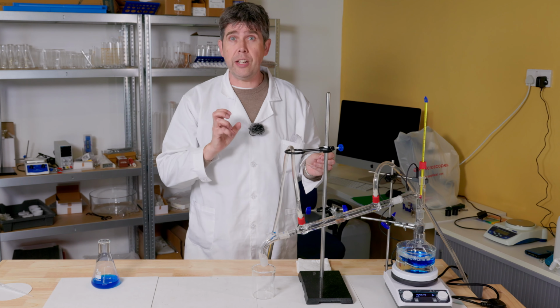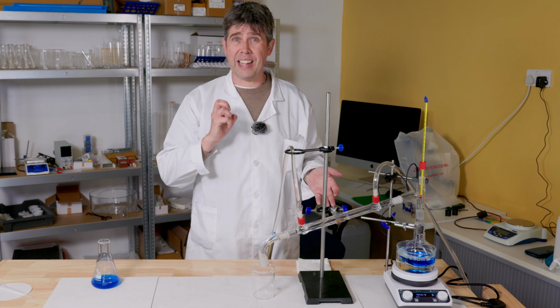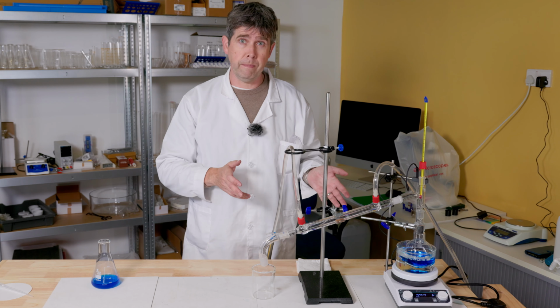This is so that I can gently fill the tube until it just overflows with water, as this will allow me to maintain a steady supply of cold water without needing to use vast quantities of water to achieve it.